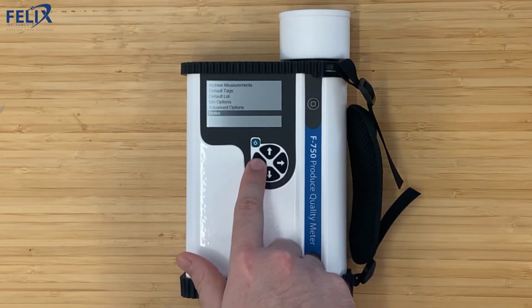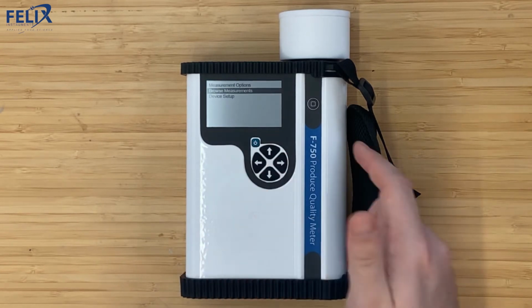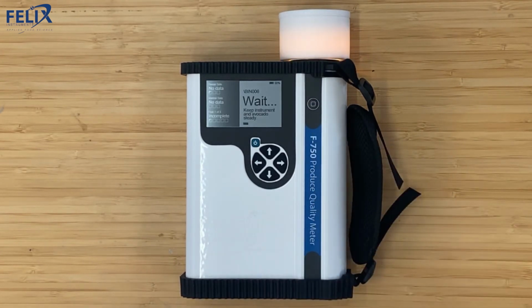So navigating back to this menu, you can see that there's a browse measurements option, but we need to take some measurements first to actually browse. So let's go ahead and click the measure button. And remember, we have it set to the auto measurement where it's going to take 3 scans at a minimum in a row. As long as those 3 scans fit our side variance threshold, which we set to 1% standard deviation, then those 3 scans will be enough for that side. If it needed to take more scans, we set the maximum at 5. So it could take up to 5 scans if it needed to in order to meet that variance threshold.